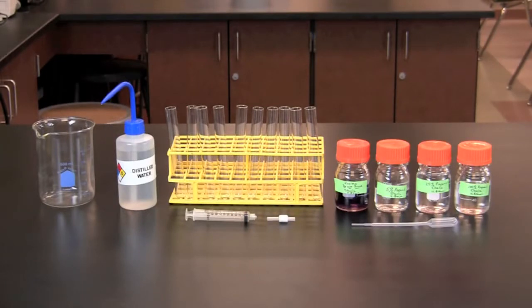In this activity, we will take solutions containing different percentages of alcohol and use these solutions to separate colors of Kool-Aid on a chromatography column. This is made possible by using differences in the polarity of pigments, the chromatography resin and the alcohol solutions.